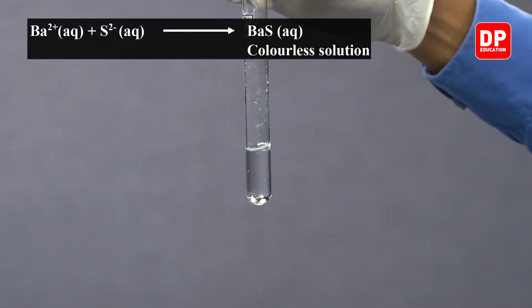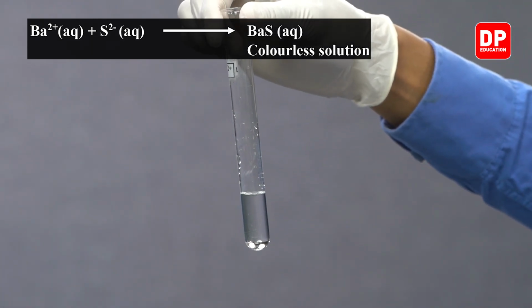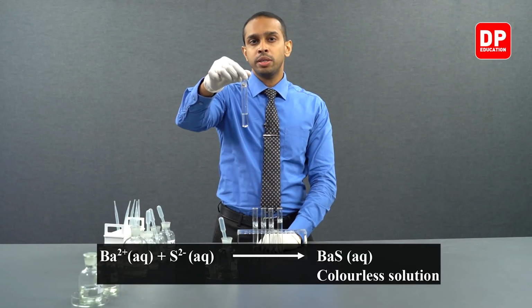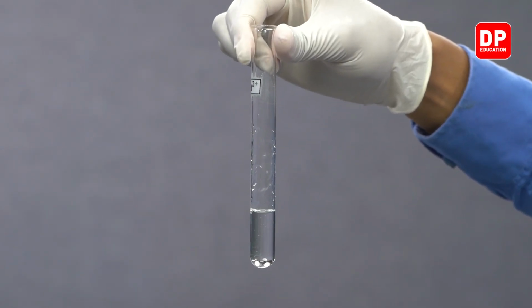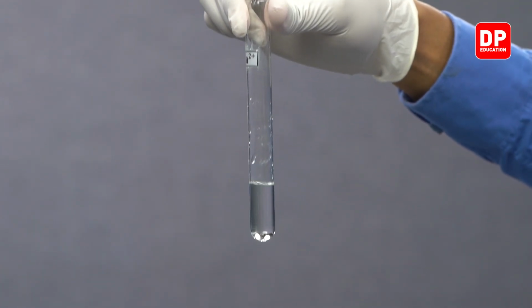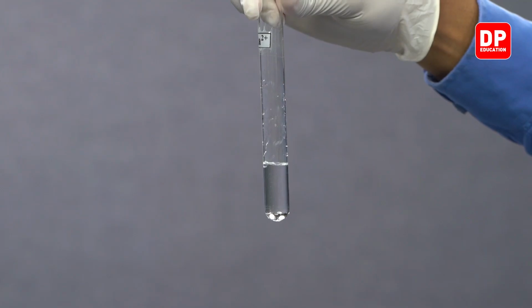Do you observe a precipitate being formed or any color change? The answer to that would be no. As barium 2 plus ions come into contact with sulfide ions, they form barium sulfide, which is a water soluble salt, so therefore you will not observe formation of a precipitate.